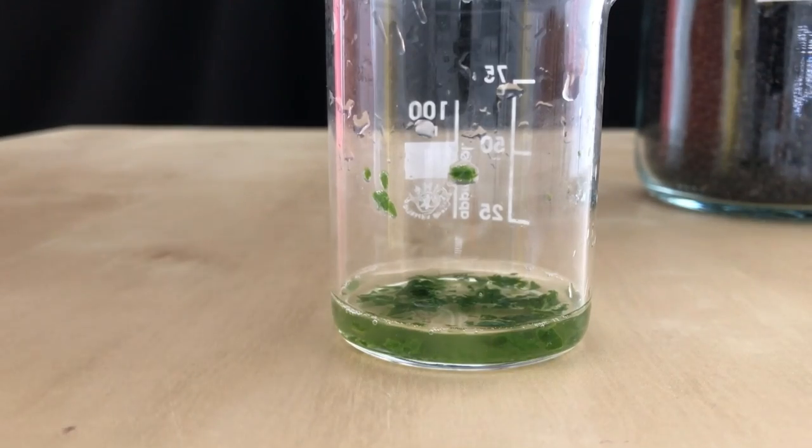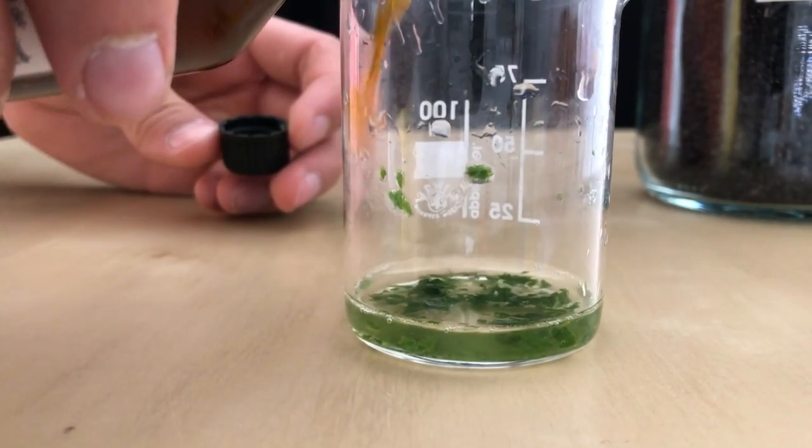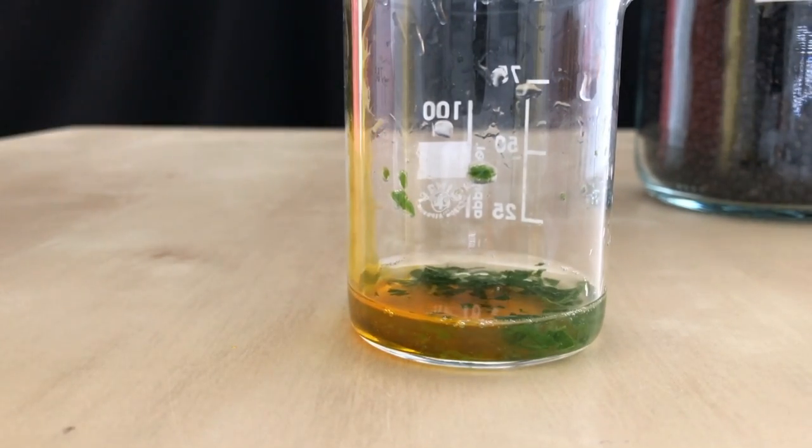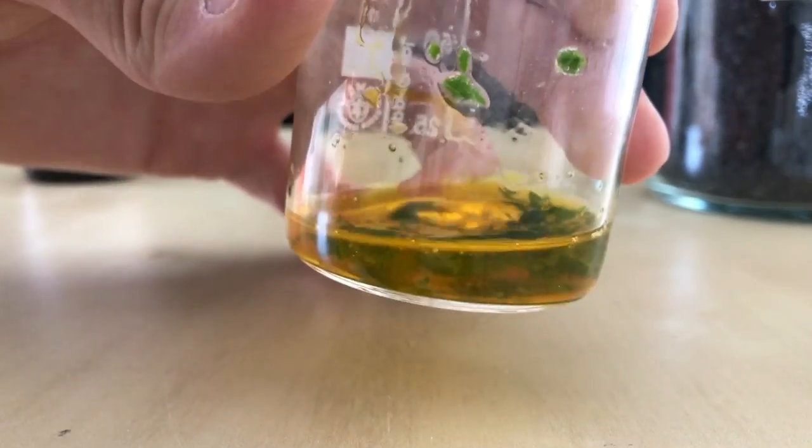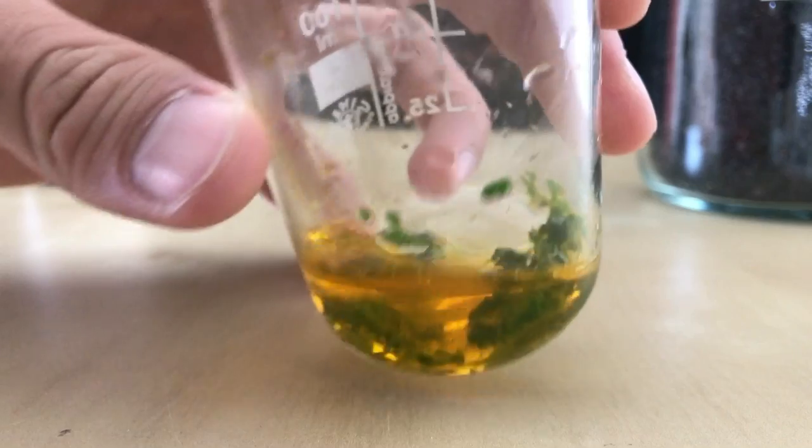To show you that the reagent doesn't react with anything, I'm going to show you the same but with some mint which contains menthol but no alkaloid. I didn't even filter it but after five minutes the solution was still clear indicating that there is no alkaloid present.